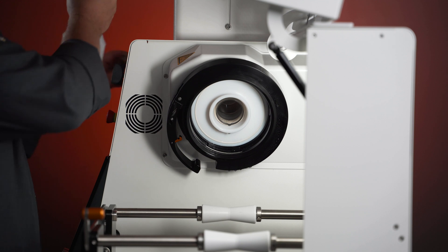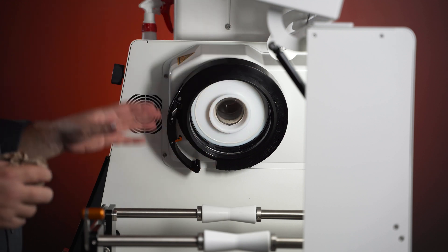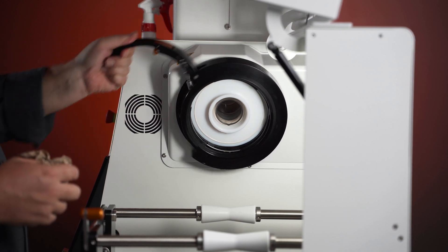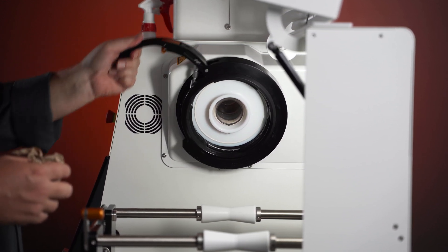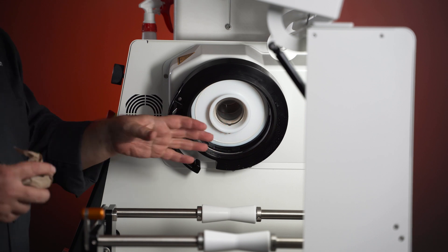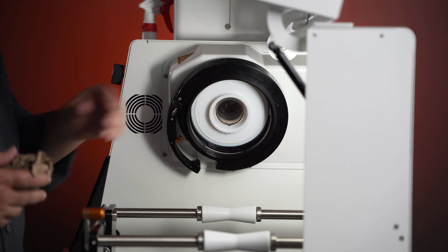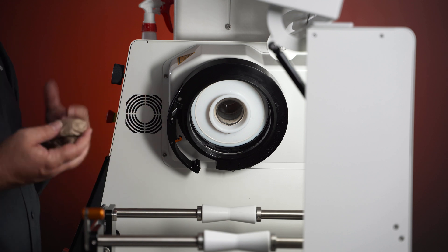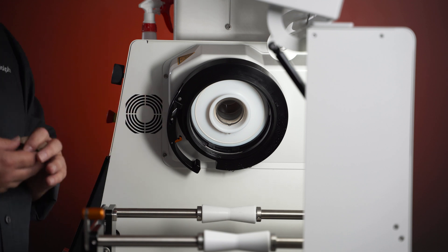Don't just do two squirts and then you're done. You should actually give it a good spray. And then once you have it sprayed, just work the spring between the guides to help break up any of the dried residue that may be collecting inside those guides and spring. That's the daily cleaning — it's very simple and I strongly recommend it.